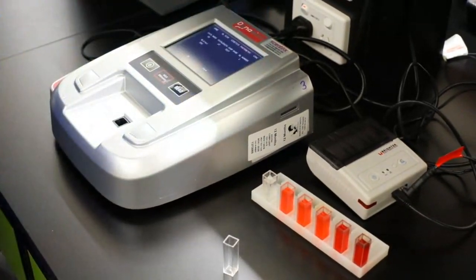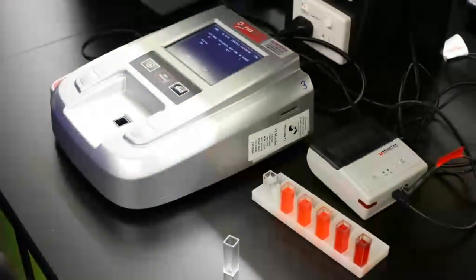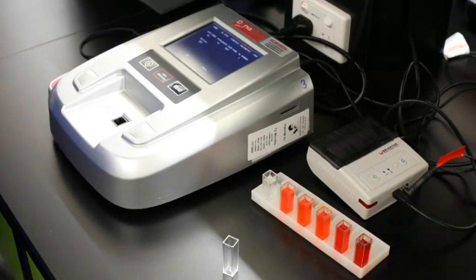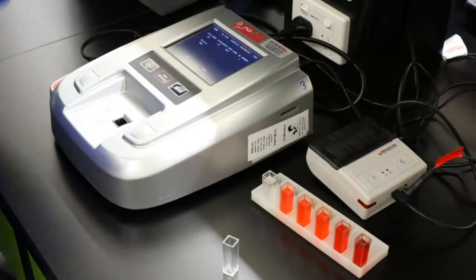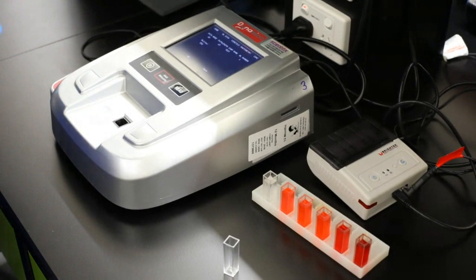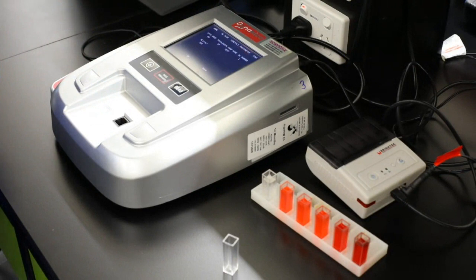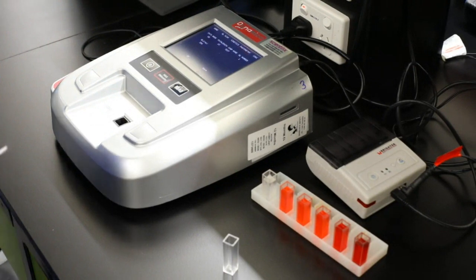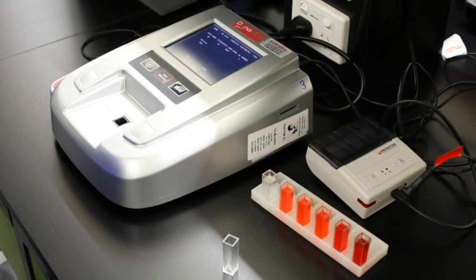Now, I've got a bit of a question for you guys. And this here is the colour red, as you can see. And it's a nice little colour range we have. But can anyone tell me, because when you use this machine, you need to use the different, on the colour wheel, the opposite side. Can anyone guess what is the particular colour we would require in our colour wheel if we're using red? Oh, good guess, not blue. Very close. Yes, you are right with that.